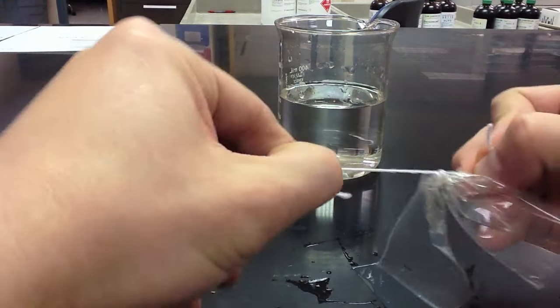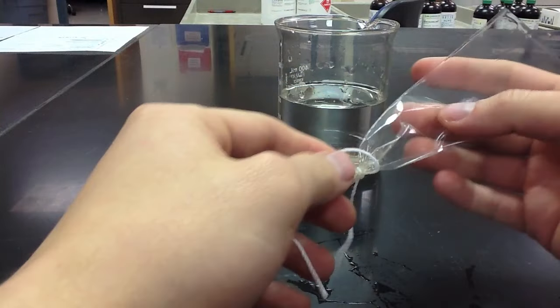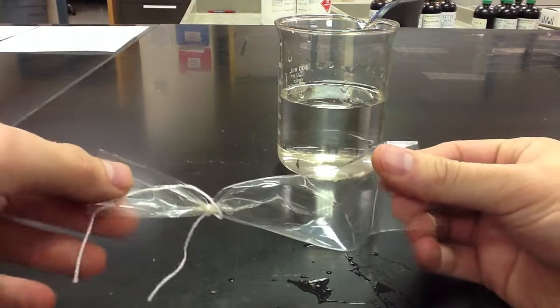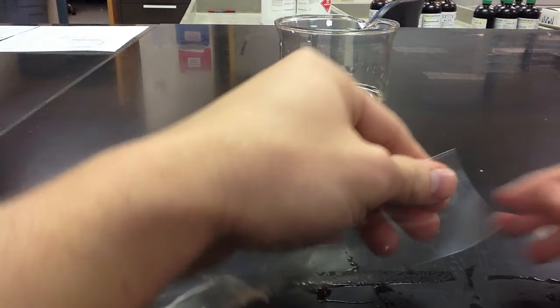Once the string is securely fastened and you're sure that no liquid will leak out of the bottom of the bag, then it's time to actually add whatever liquid it is you're going to add to it.